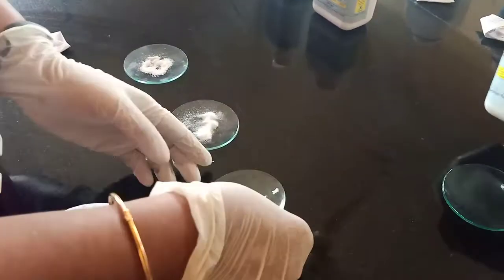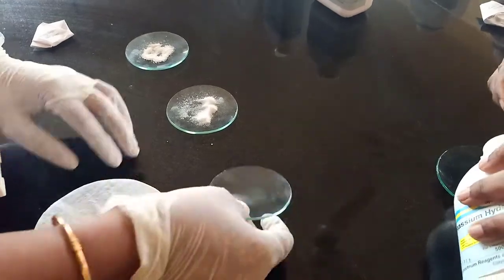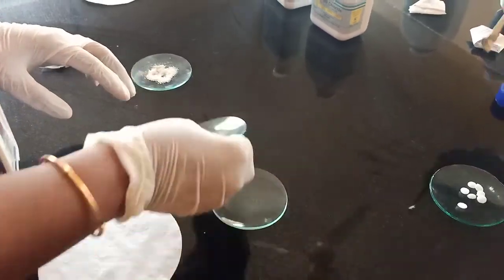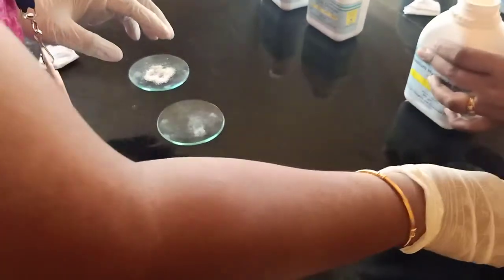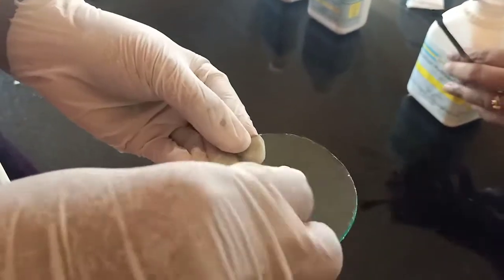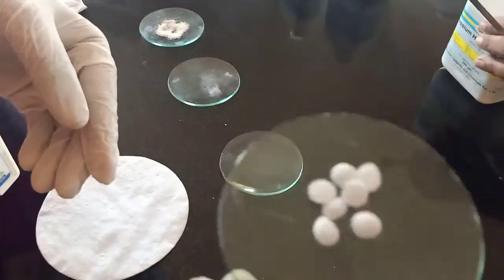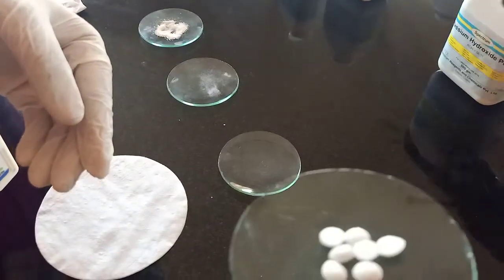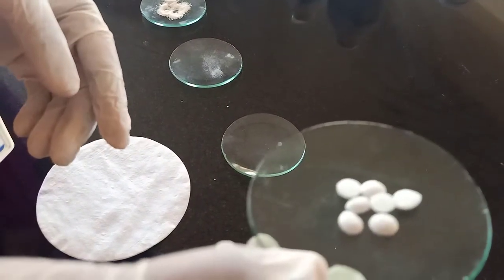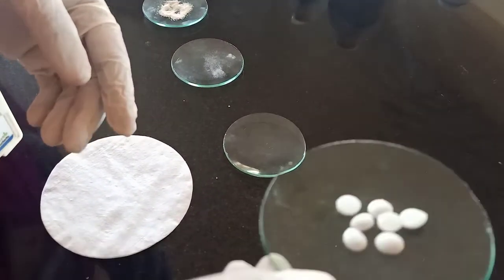Shall we see potassium salts now? Potassium hydroxide will always be in this pellets form. See here — like naphthalene balls, you will see. Same like that. This is potassium hydroxide pellets.